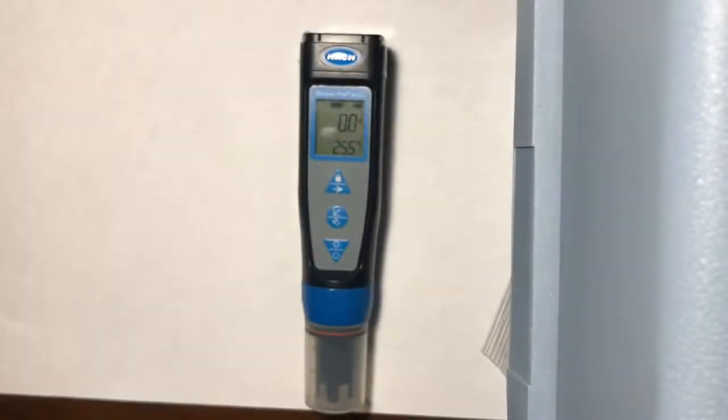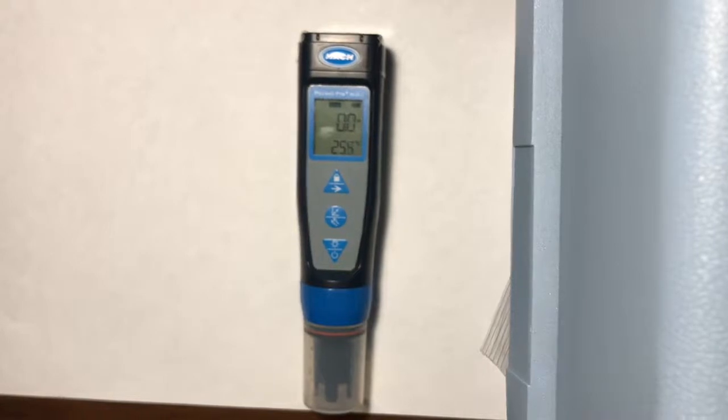This video will show you how to troubleshoot and reset the Hach PocketPro Plus Multi-2 tester if you are having difficulty calibrating it before a test day. The Hach can be a little finicky with inexperience, with such minimal symbols on the meter itself. You or a previous volunteer may have inadvertently changed some settings while calibrating or in regular use. This can cause issues when you go to calibrate and can cause inconsistencies when you collect data. But don't worry, this is easily rectified.